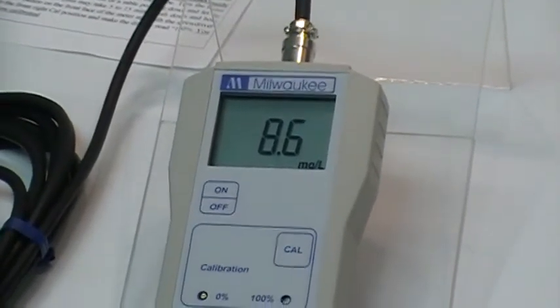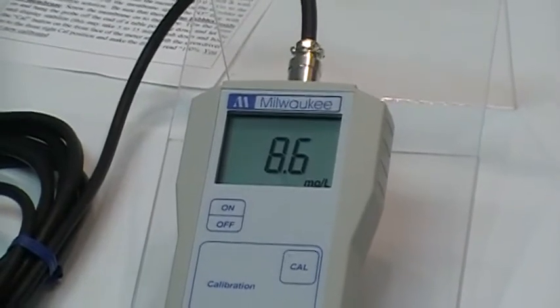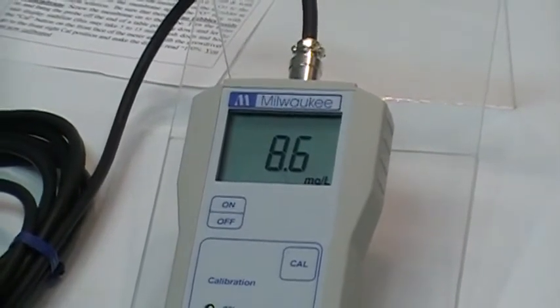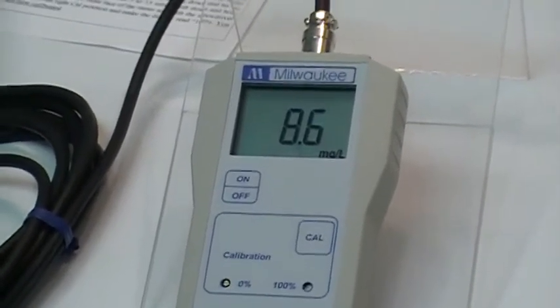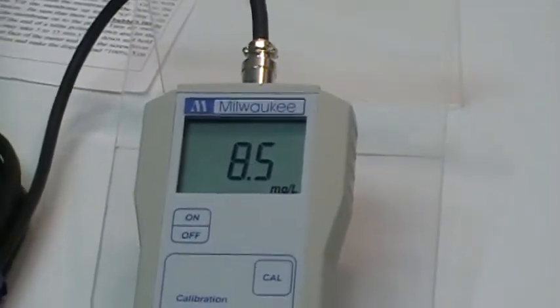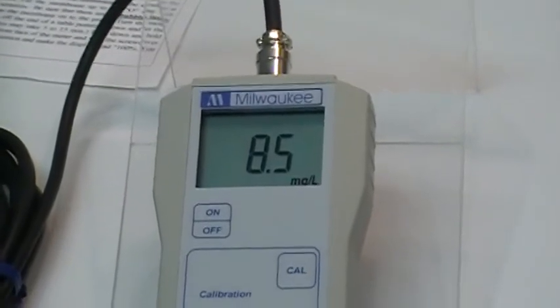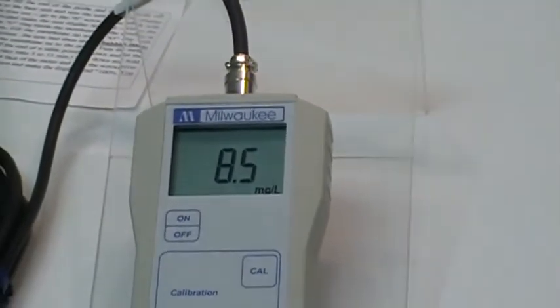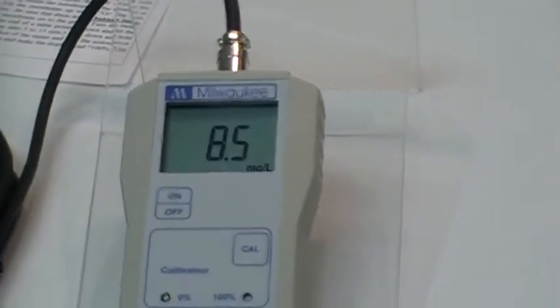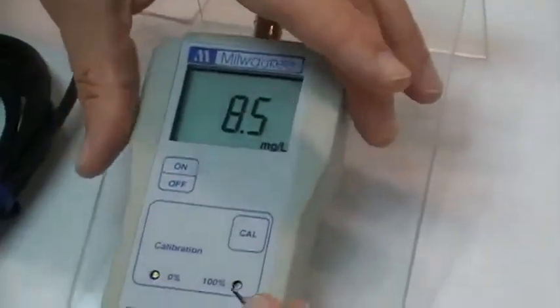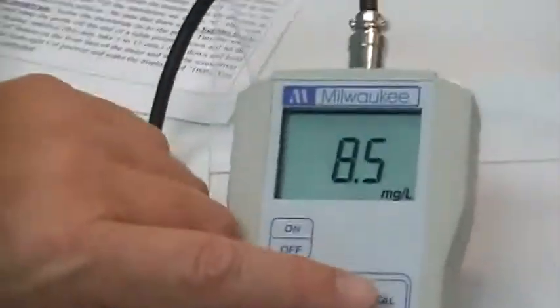Usually this procedure will take between 5 and 10 minutes to stabilize. We recommend giving it at a minimum of 5 minutes before it is stabilized. For the sake of shortening this demo, we're going to go ahead and do the 100% cal position. So as you see it's sitting at 8.5 right now.